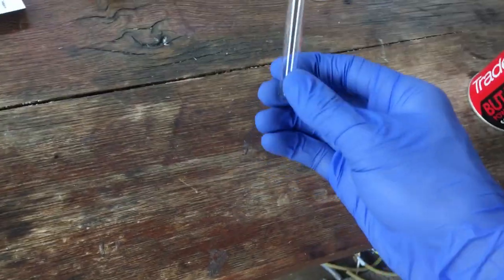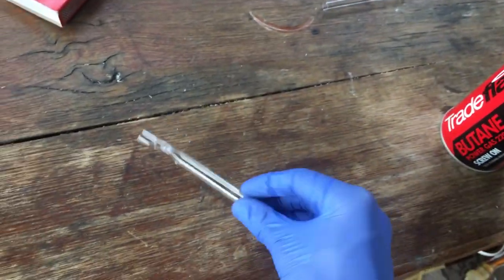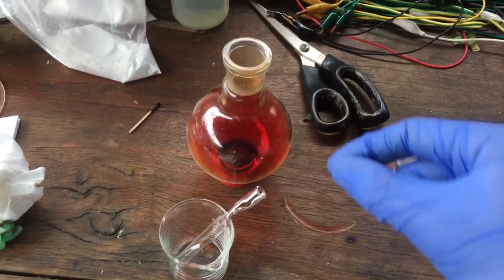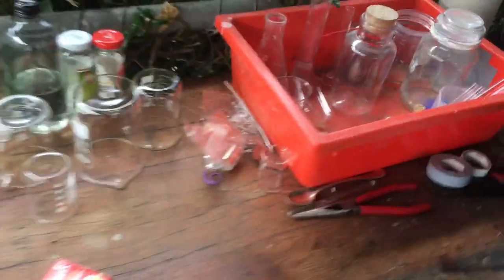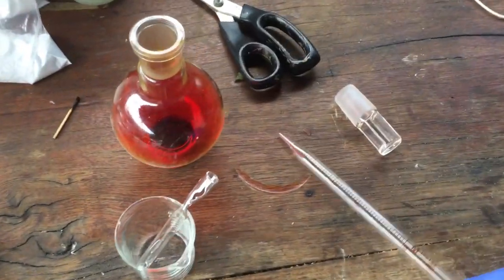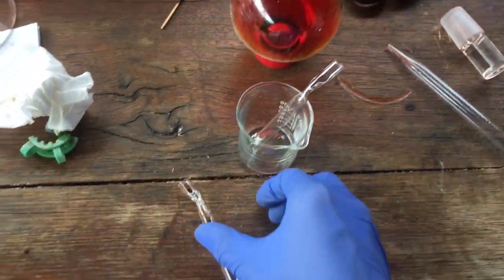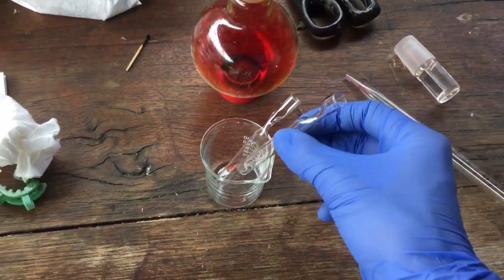We'll add the bromine into one of these and then see if we can seal it off. So now the job is to try to get the pipette and try to pipette the bromine into the ampoules, and then we should be able to seal them.